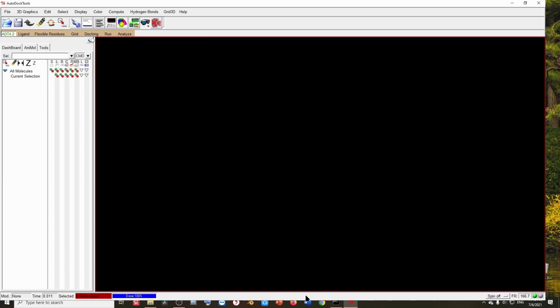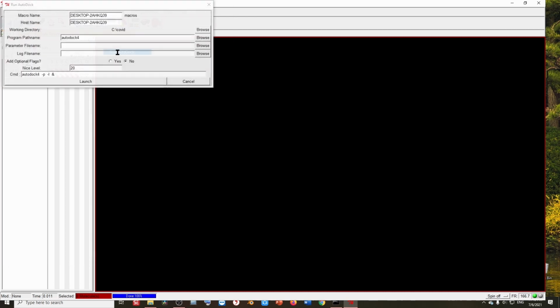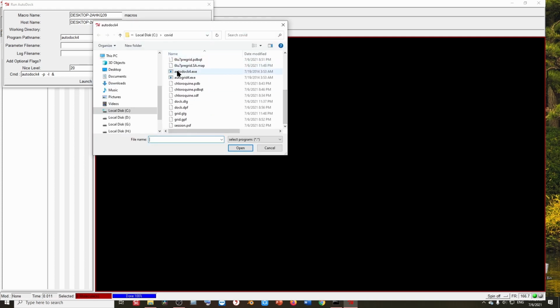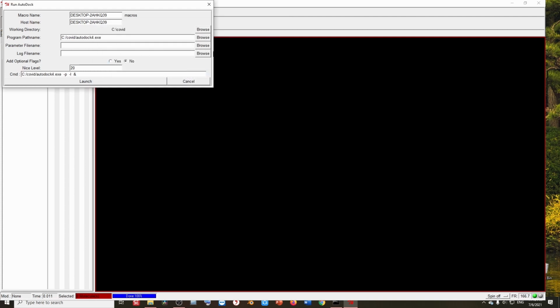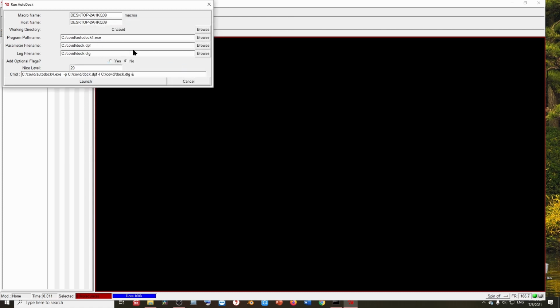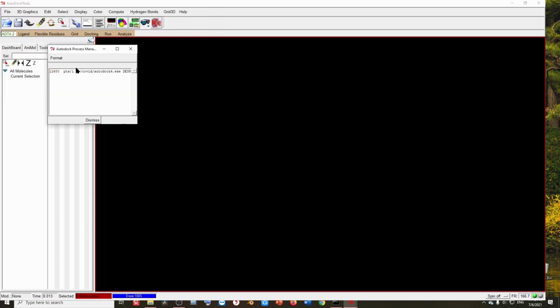Thankfully, AutoGrid has finally run, and now I can run AutoDock. Let's go to AutoDock. Let's go to Browse. Here I'm going to select AutoDock 4, and the parameter file is here. Again, it should not contain spaces, remember this, and let's launch it. It's running fine, thankfully.